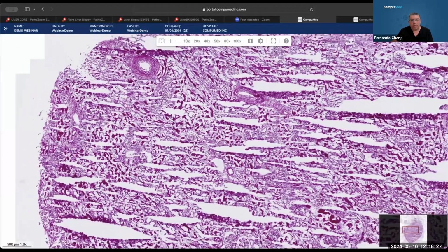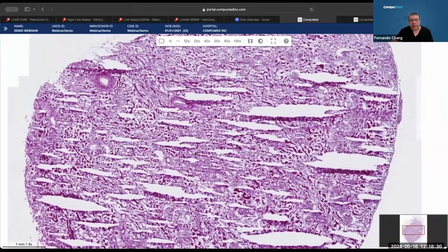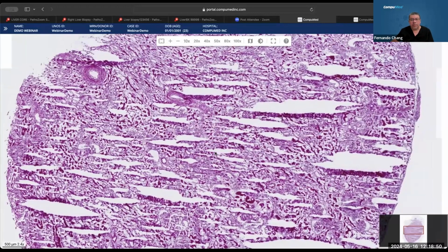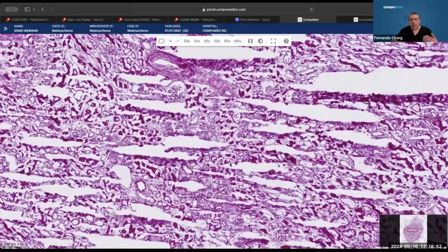We can actually talk a little bit about the differentiation when we talk about the thickness of the section. A lot of people say it is overstain, but it's not overstain, it's actually thick. It's past the 5 microns. Remember when we mentioned that it has to be standardized at 5 microns. Perhaps the cryostat was not set at 5 microns, so it gives you a thicker section, or when we go through the stainer, the staining is a little more intense and it might be rendered as overstain, but it's really the thickness that is the problem here.